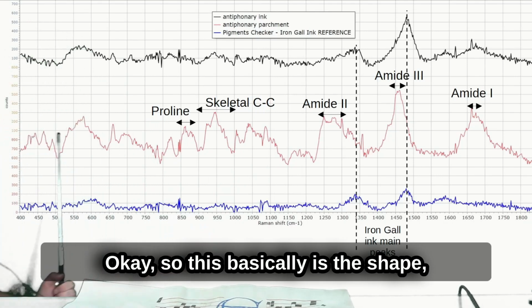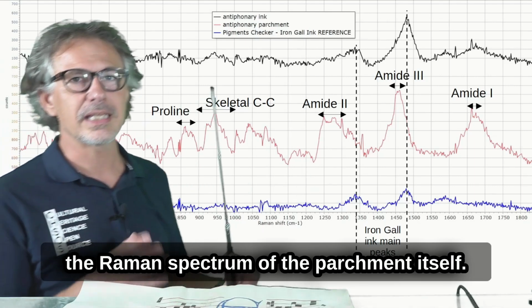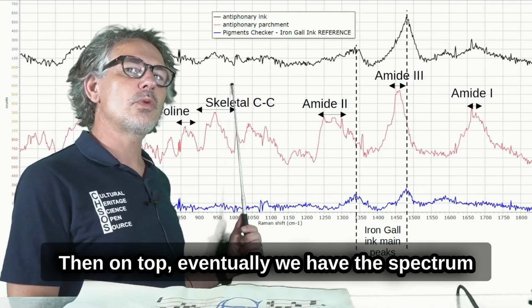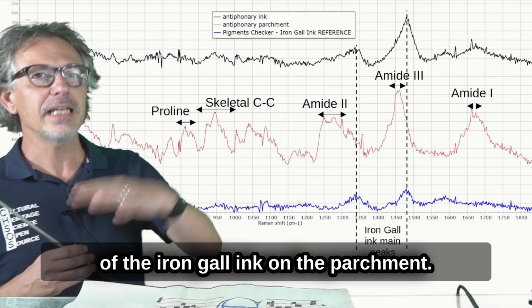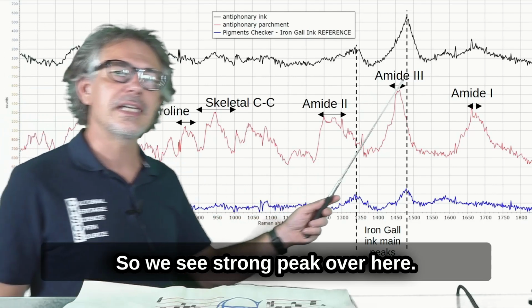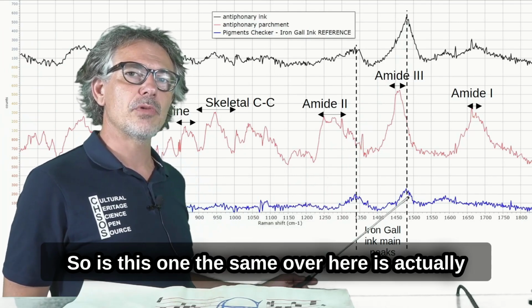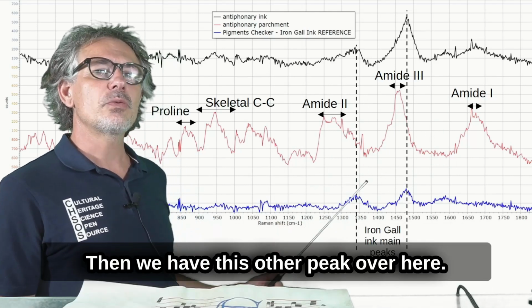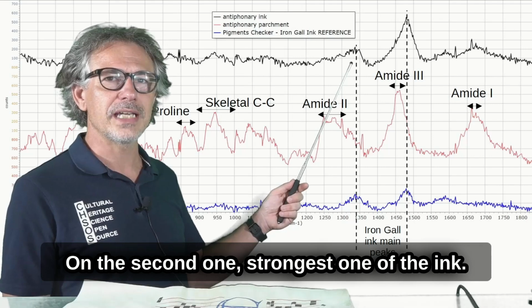Okay, so this is basically the shape of the Raman spectrum of the parchment itself. Then on top we have the spectrum of the iron gall ink on the parchment. We see a strong peak over here. This one is the peak of the ink. This one, the same over here, is actually stronger than the one we have in the pigment checker. Then we have this other peak over here, the second one, the strongest one of the ink.